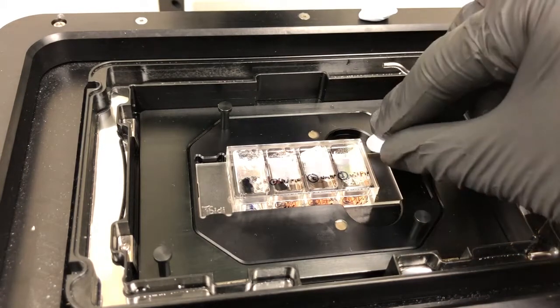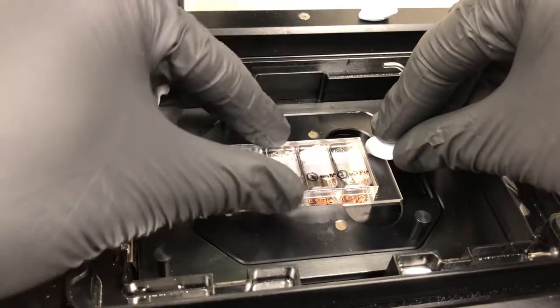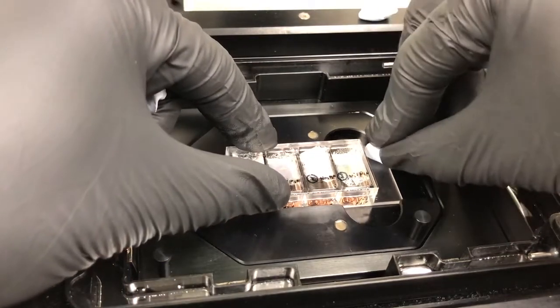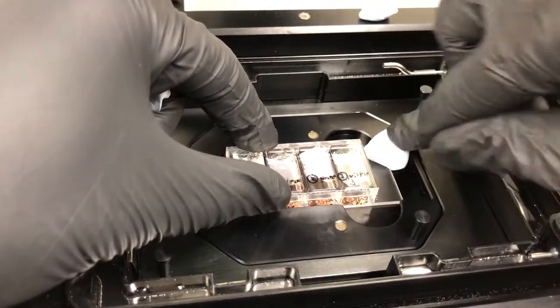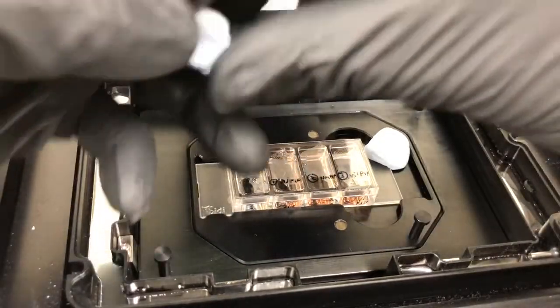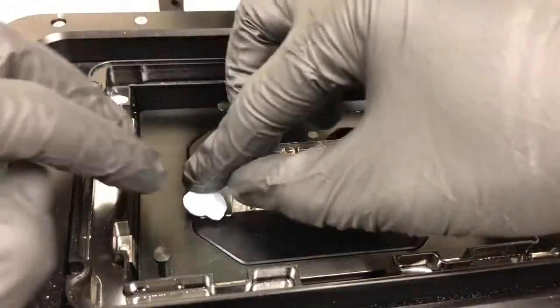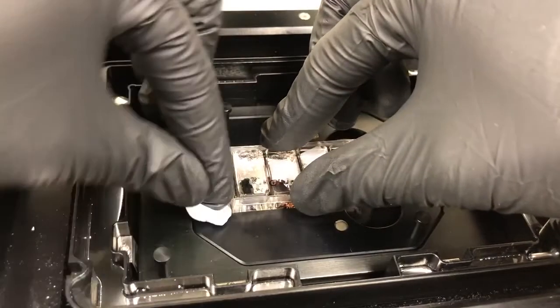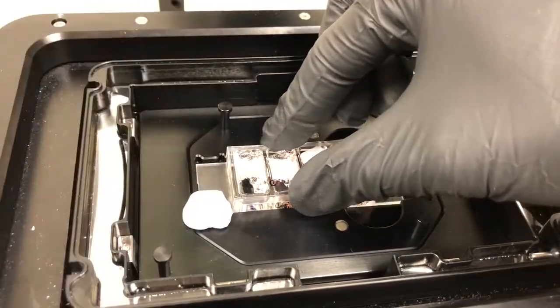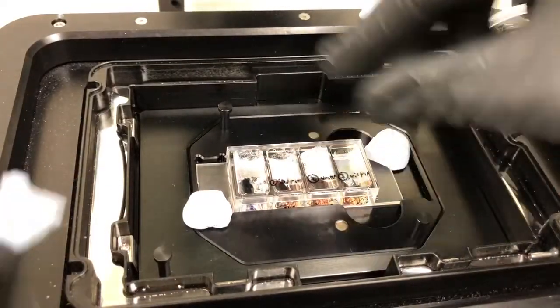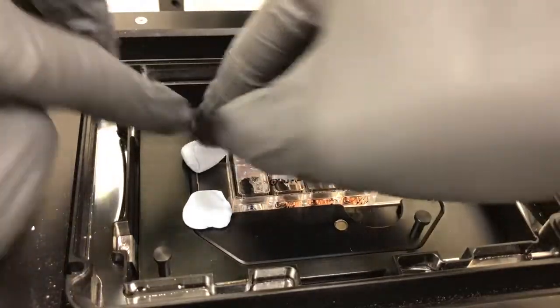I'm going to put this down in one corner and place that there, and then place this here in another corner and here in another corner.